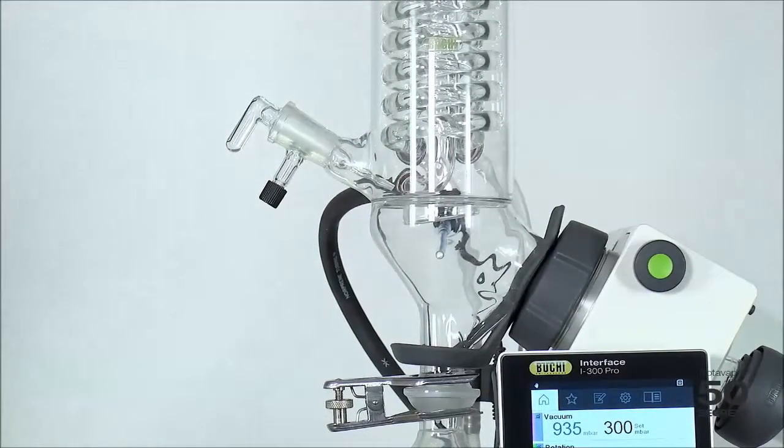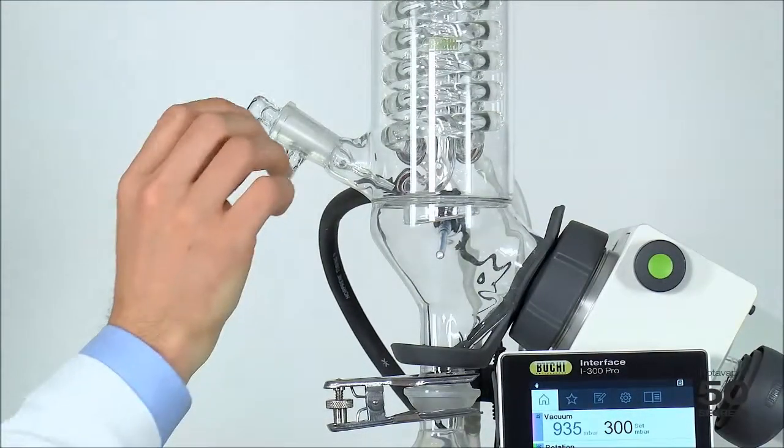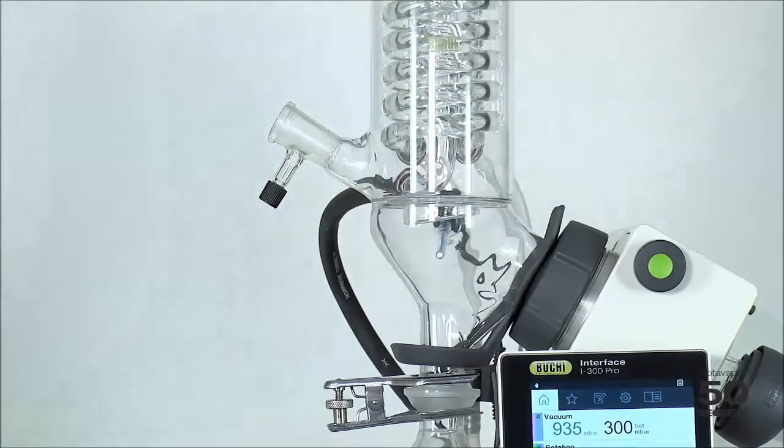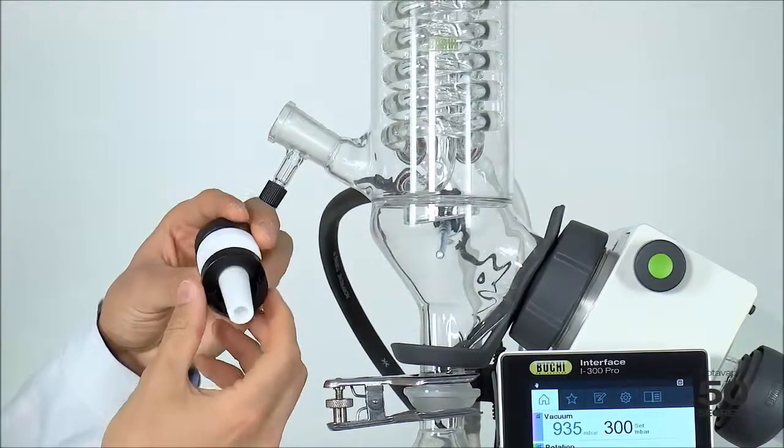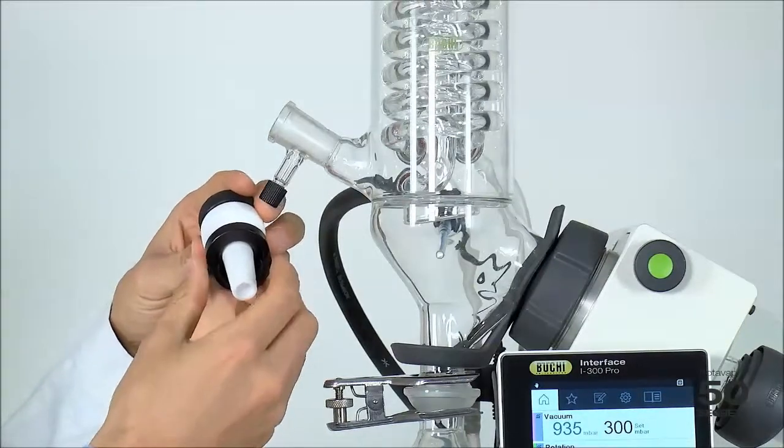In order to install the foam sensor, we first have to remove the stopcock. We have to remove any grease if there is any, and then we use this tool which is delivered with the foam sensor.